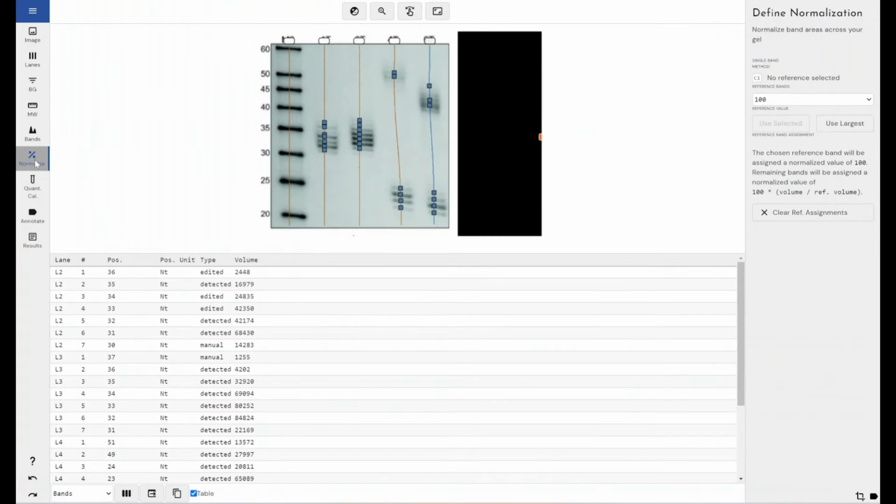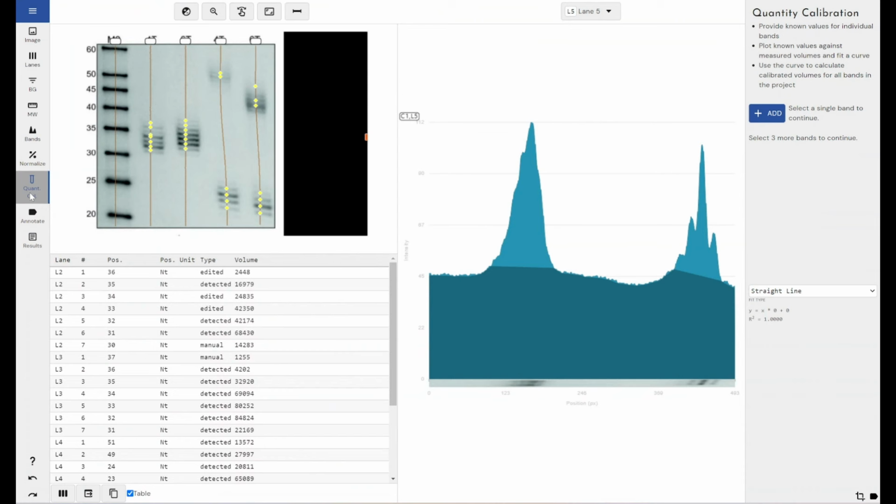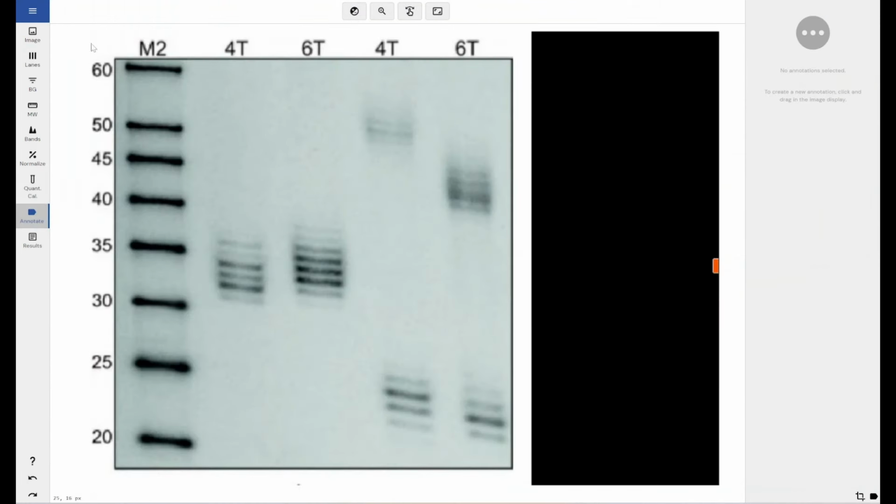If I had any normalization, if I had any standards or a normalization channel or a total protein channel within my image, I could perform normalization here, but I don't, or certainly I don't within this experiment. Quantity calibration, again, I don't have any known standards within this experiment to relate my bands back to calculate quantities or standard curves or anything like that. Annotation, well, if I didn't have this annotation on my image, I could add it manually. Luckily I do, but if I didn't, I would left click and then put in things like 4T here, press enter, 6T here. And if you want to check out more about the annotations mode within Phoretix 1D and what it can do, I've got a separate video on that runs through all of the different options that are on the side here.